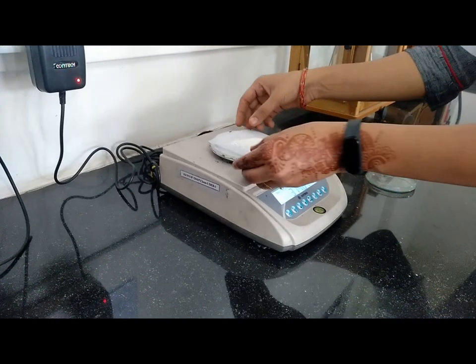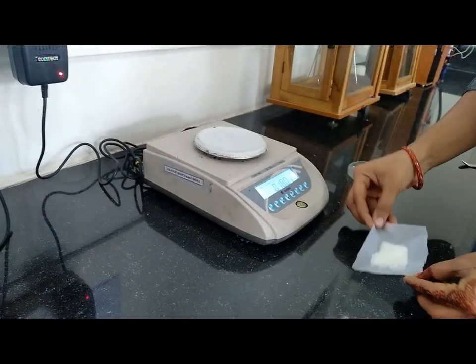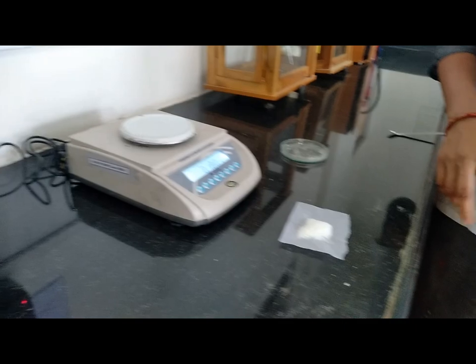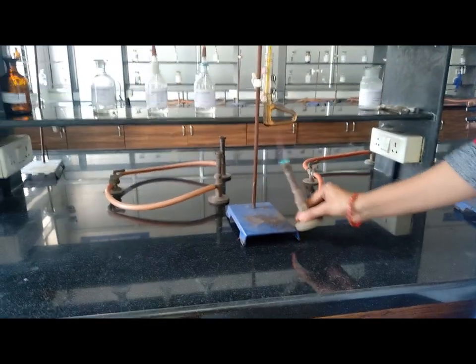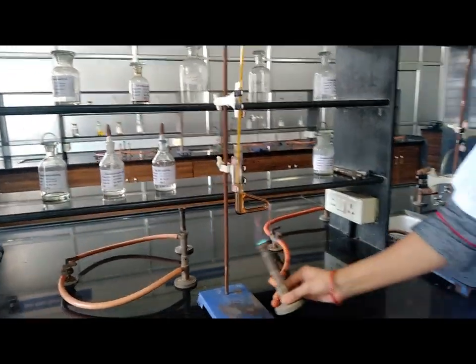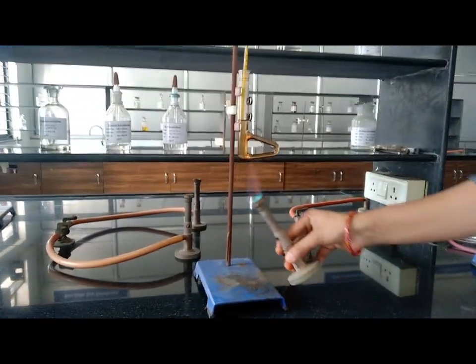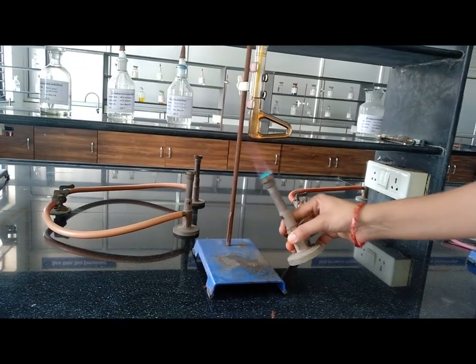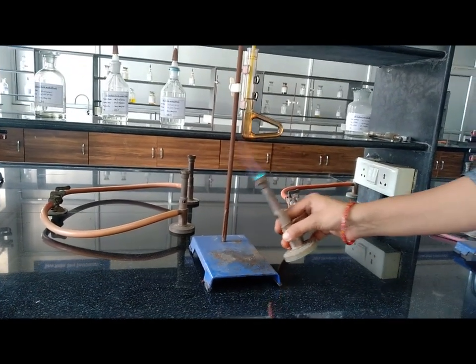Now let's determine the melting point of this benzoic acid. First, fill the capillary with benzoic acid, then assemble like this and heat continuously so that we get uniform heating and proper, sharp melting point.